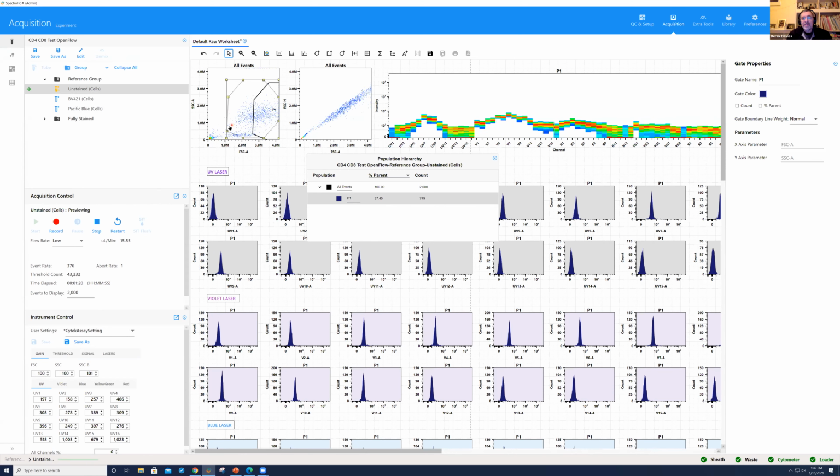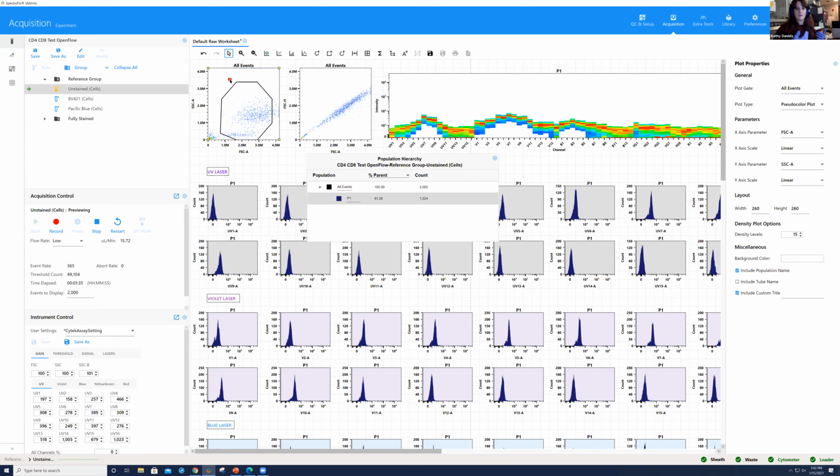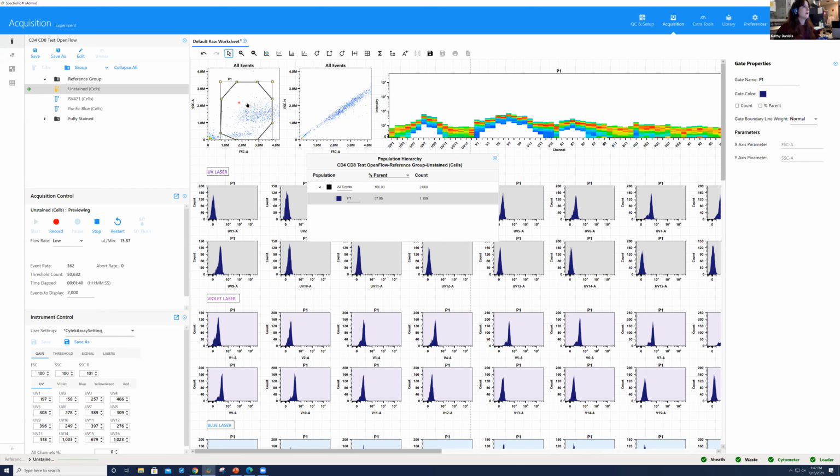Okay. So I suppose, Kathy, that's very similar to what we looked at when we were doing the Diva. And exactly, when we set the machine up with beads, the voltage is way too high for what we'd expect with cells. 100%. Yeah, there's going to be a very big difference between beads versus cells. And that's why using the gating and using the population hierarchy can be really helpful for us in order to understand where our cells lie. But definitely. Okay. So then you'll also see that even though I have most of my cells on scale, it's still a little bit high.